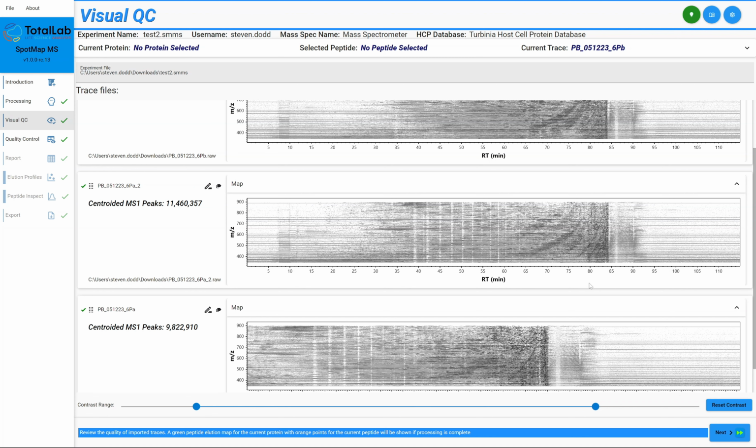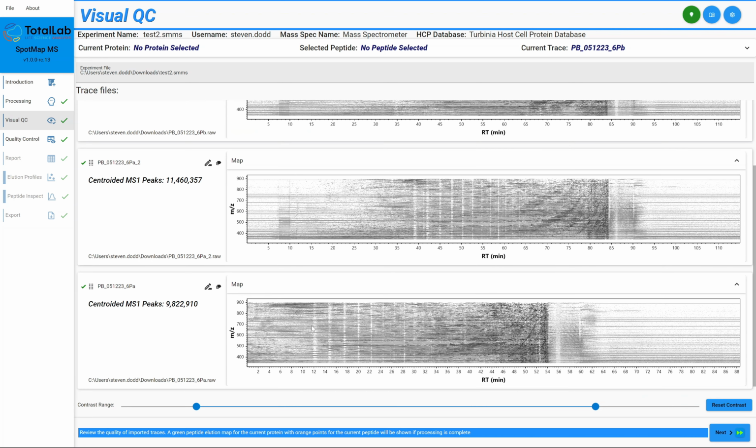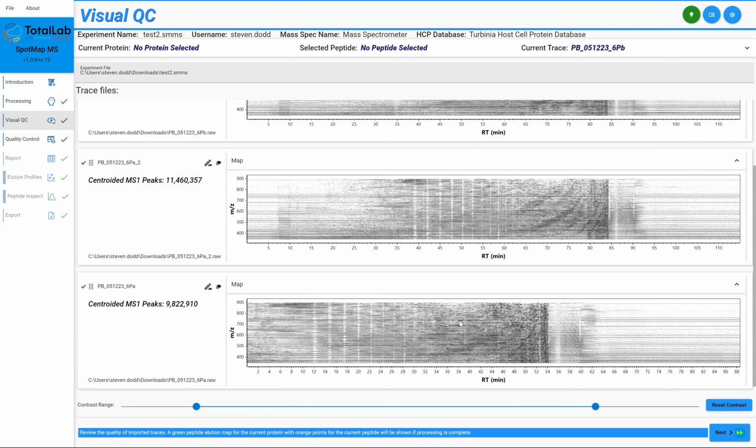Now I'm going to show you how the visual QC can be used when an experiment has gone wrong. This is a different experiment that we actually commissioned as part of the development of SpotMap MS. Again, these are the same sample repeated 3 times, but within the visual QC section we've got some similarities, but some significant differences. These are largely similar, although we've got these white lines, this banding going along. But certainly sample number 3 has eluted much quicker than the other 2 traces. This indicates to us that perhaps this run has not gone correctly. Something's gone wrong and we need to repeat it.